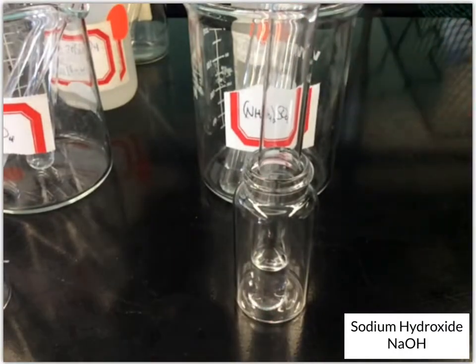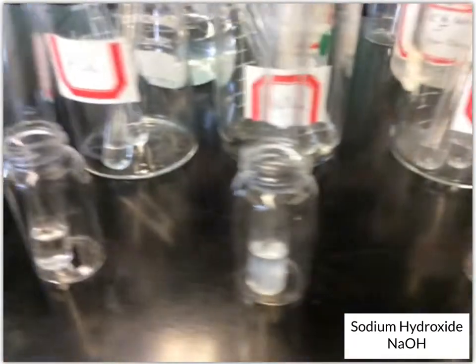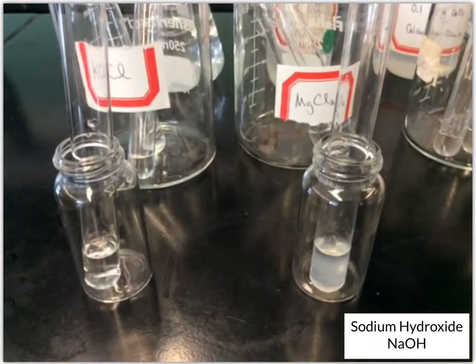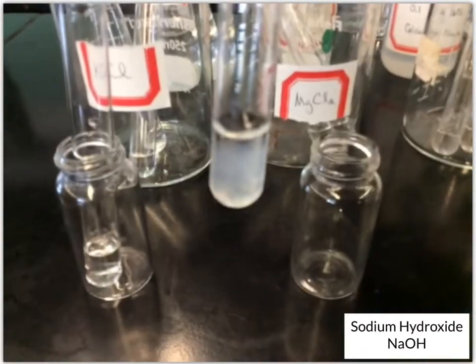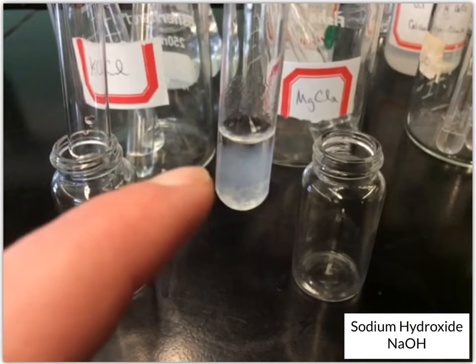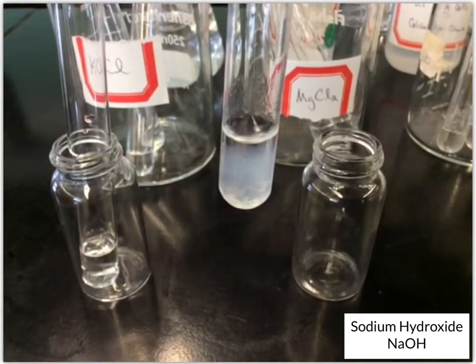Okay, so we did have several that changed. Let's go back and look at these. We've given them a little bit of time to sit. We've got the magnesium chloride, and so you can see the top now of that solution is starting to get clear, and that's because that white solid is starting to sink.